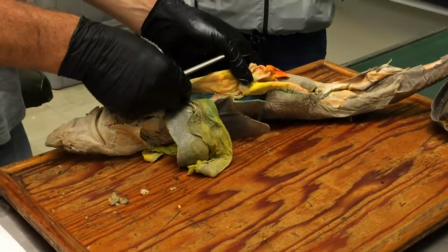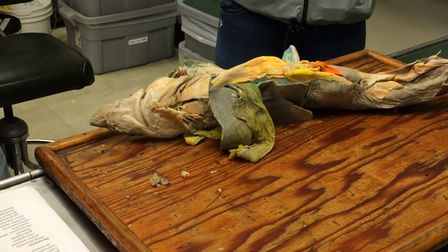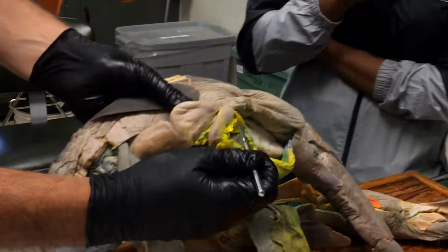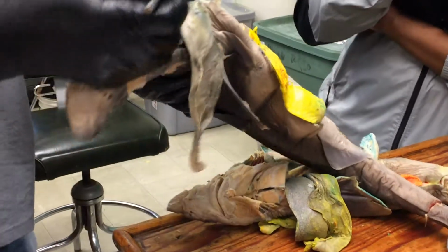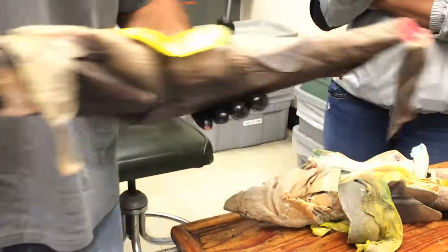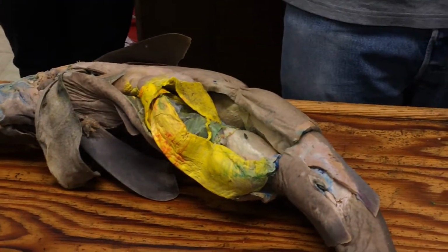These terms are a little confusing to people. The greater curvature and lesser curvature actually come from human anatomy. Easier to see on this one since it's not been cut open. The greater curvature of the stomach is the outside that curves around like this. The lesser curvature is the inside that curves around like this. So this is the greater curvature here, and this is the lesser curvature here. You see it at all, Mackenzie? Okay. Those same terms are used in human anatomy or mammalian anatomy in general. Okay, intestine, spiral valve, we already saw.